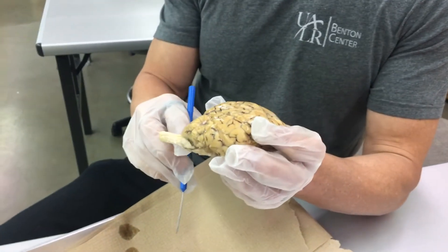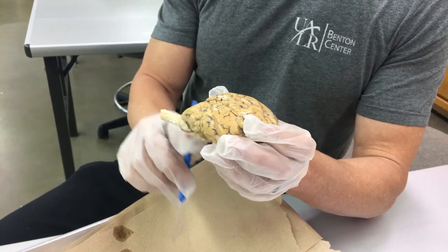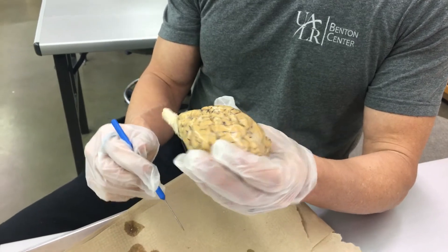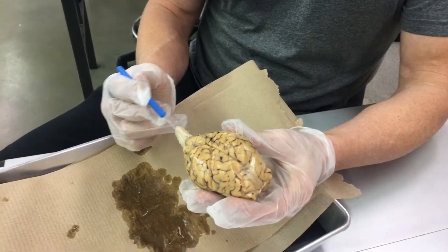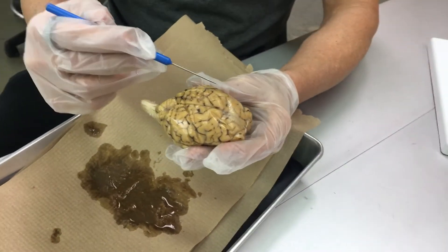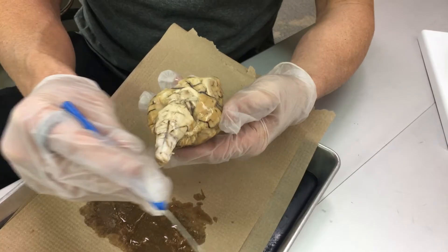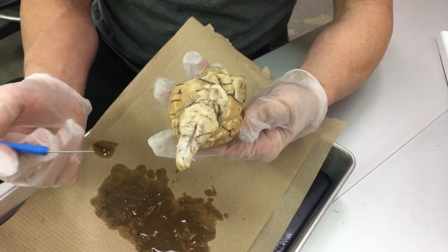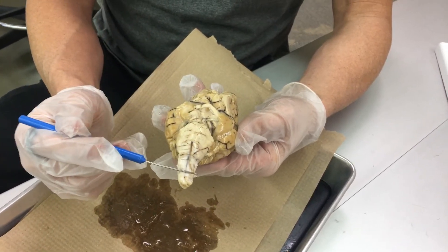This is all the cerebrum of this sheep. Notice how the spinal cord comes out the back side. Our spinal cords are vertical; theirs are horizontal because they're quadrupeds and we're bipedal. This is the cerebellum right here, and that's going to deal with balance. Here's the cerebrum, and then on the underside you can see the brain stem. There are three parts to the brain stem: the midbrain, pons, and medulla.